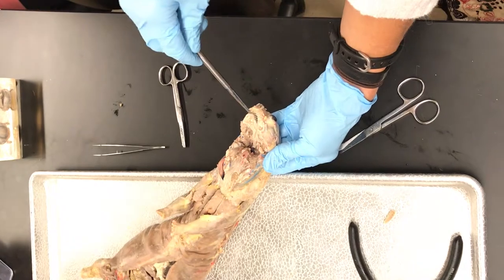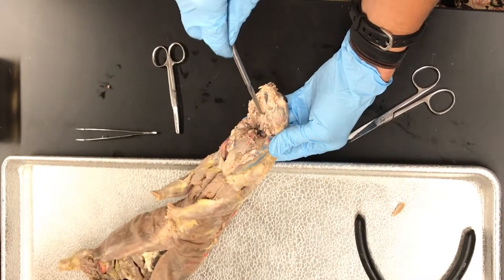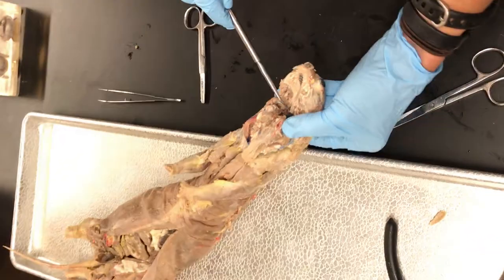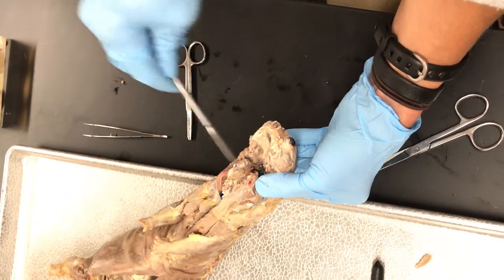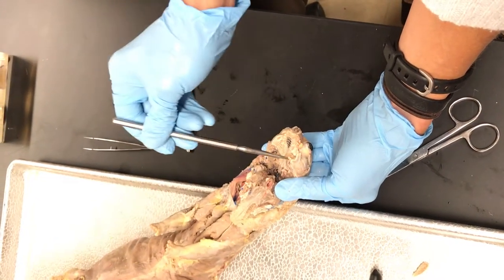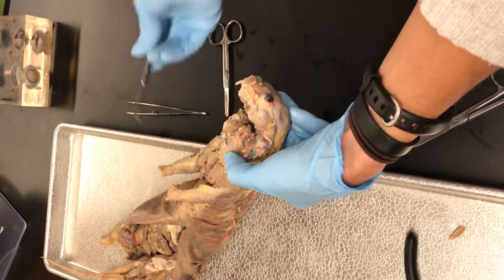So now we've got our hard palate, right between the teeth up here. And then the soft palate - where the teeth have kind of stopped, so that would be our soft palate. And then there's a hole on the roof of his mouth - that's the opening to the nasopharynx. The internal nares are on either side, about where that soft palate is. And then the tongue, obviously.